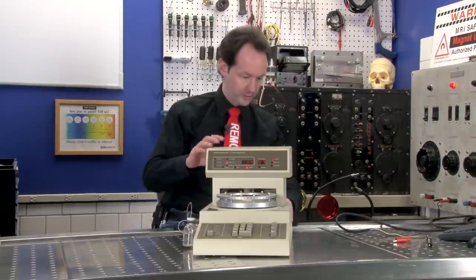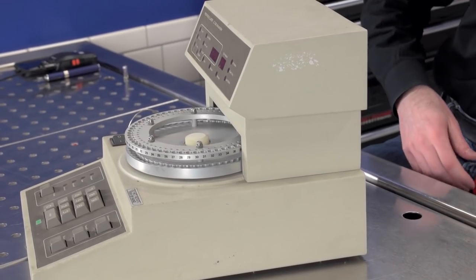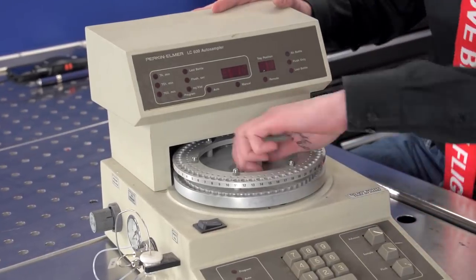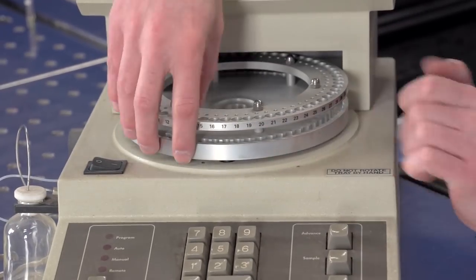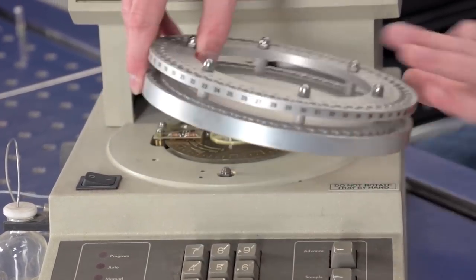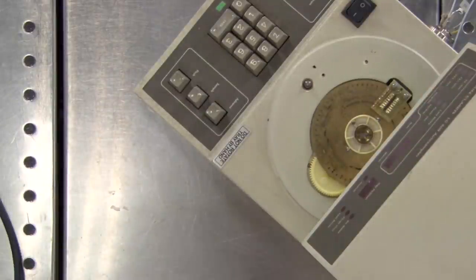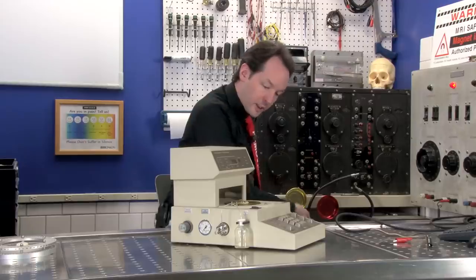So let's dig into it. It's really well built. Like the majority of this thing is just one big casting. I think I can probably just take this off right here. Oh, wow. Hey guys, check this out.